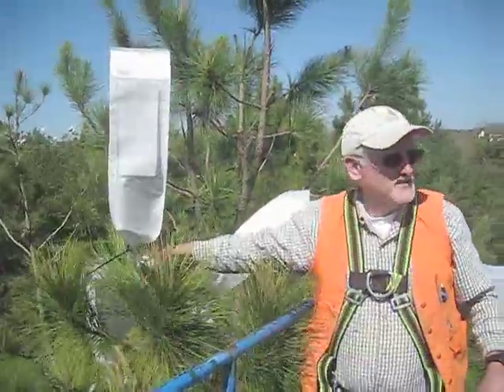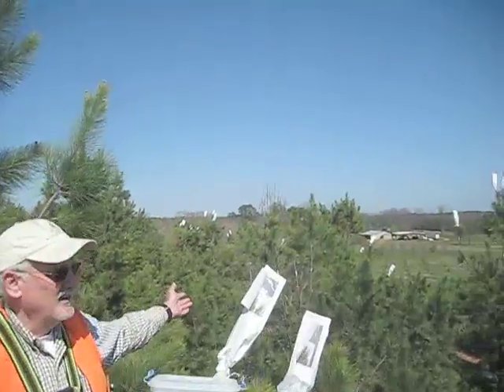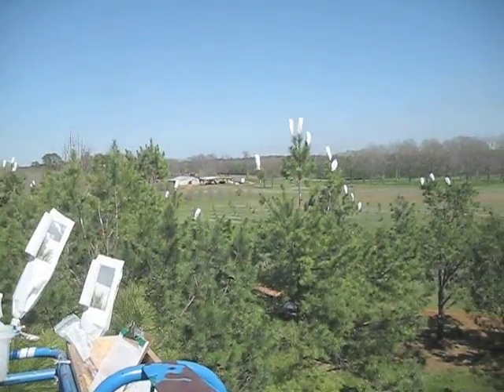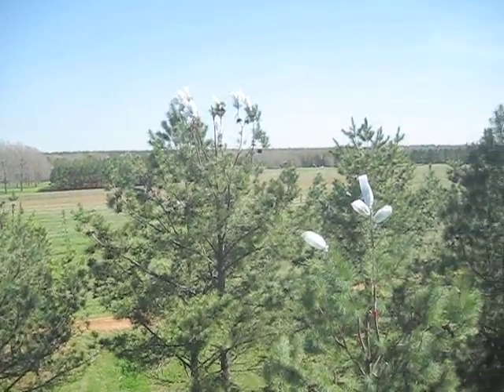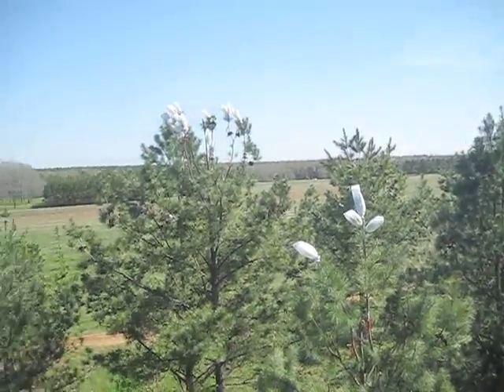This is a technique that's been used for years in pine. You can see here in our breeding orchard there are lots of pollination bags — we put up over 300 this year. The pollination season is just starting, but over the next week or so we should have all these crosses made.